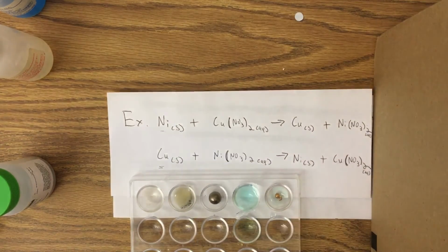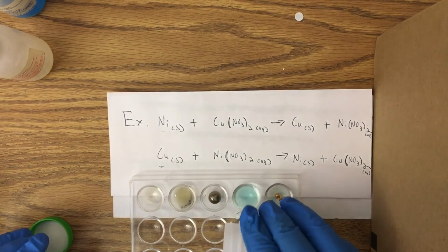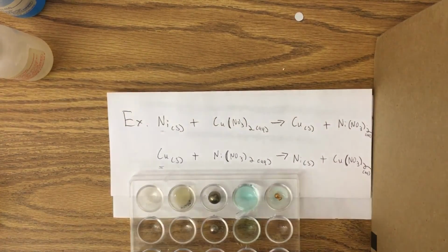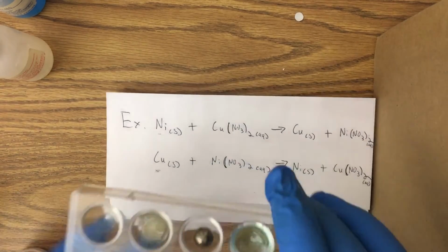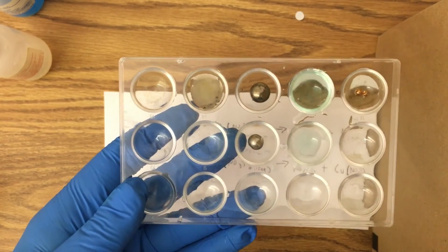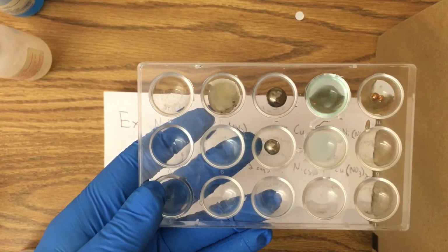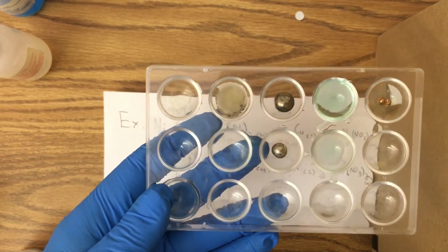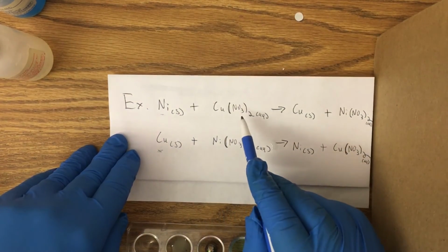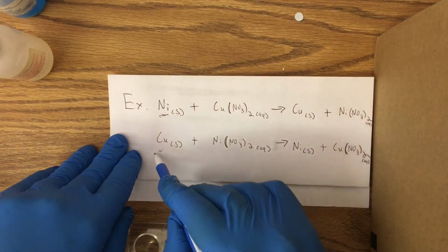I'll set these both down in the well plates so that you can see the difference. If we look at these, we see one has that copper kind of brown sheen to it, and this one is completely silvery like nickel metal typically is. So this reaction, nickel with copper nitrate, was able to occur. This reaction was not. This proves that nickel is a more active metal than copper.